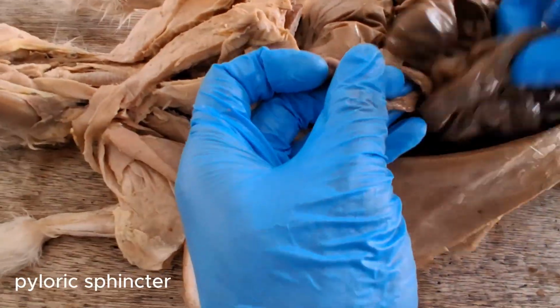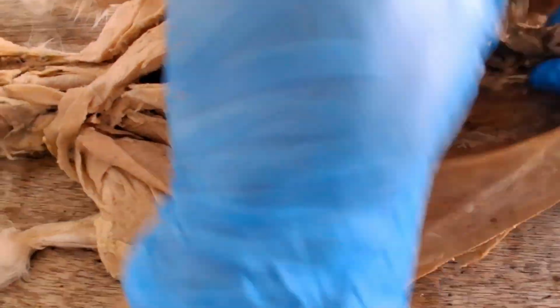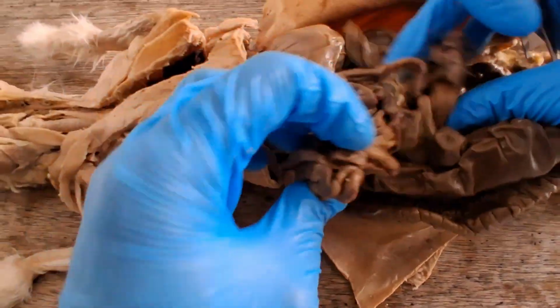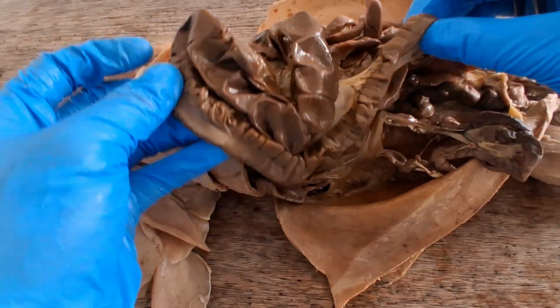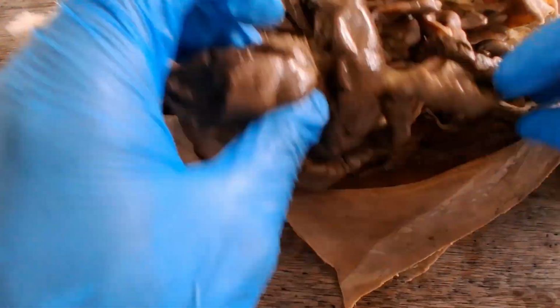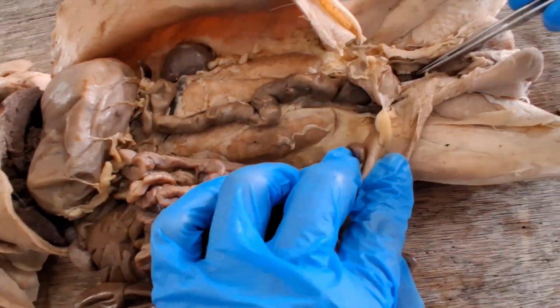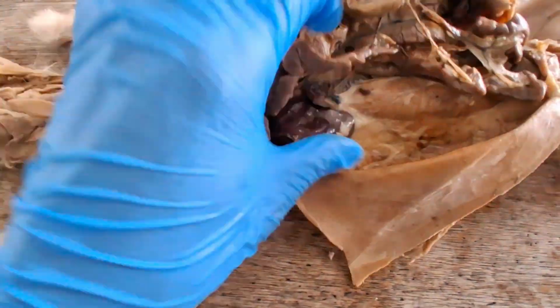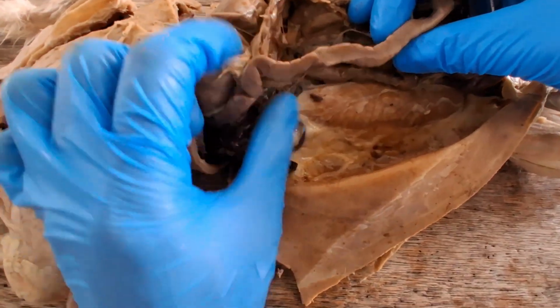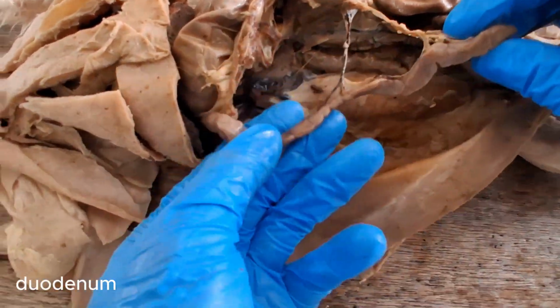And technically this is already the small intestine, but it's very long, subdivided into different segments. All of these are small intestines. This one is already the large intestine or colon, and it terminates down here in the descending colon down to the pelvic cavity as the rectum, and then to the anus. So this first portion, the one adjacent to the pyloric end of the stomach, is the duodenum. This is the duodenum.